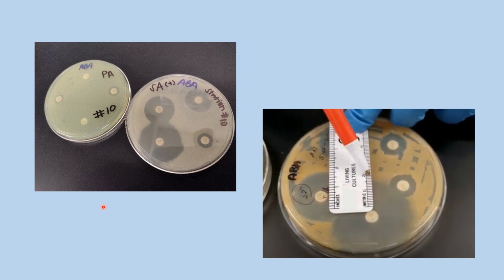You notice that the gram-negative, a couple of these have a very narrow zone of inhibition, but the antibiotics are definitely much more effective against the gram-positive organism. And this right here has the largest zone of inhibition, so this would be, of these choices, your best choice to use, the most effective in controlling the growth of this particular bacterium.